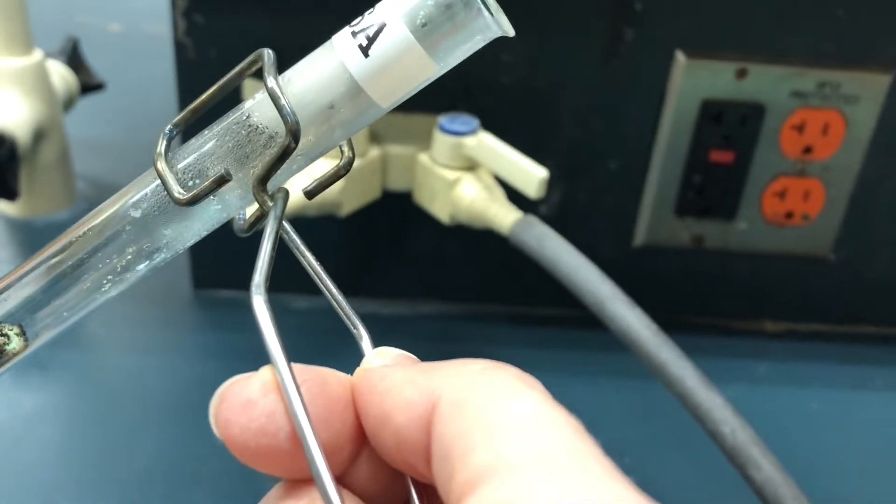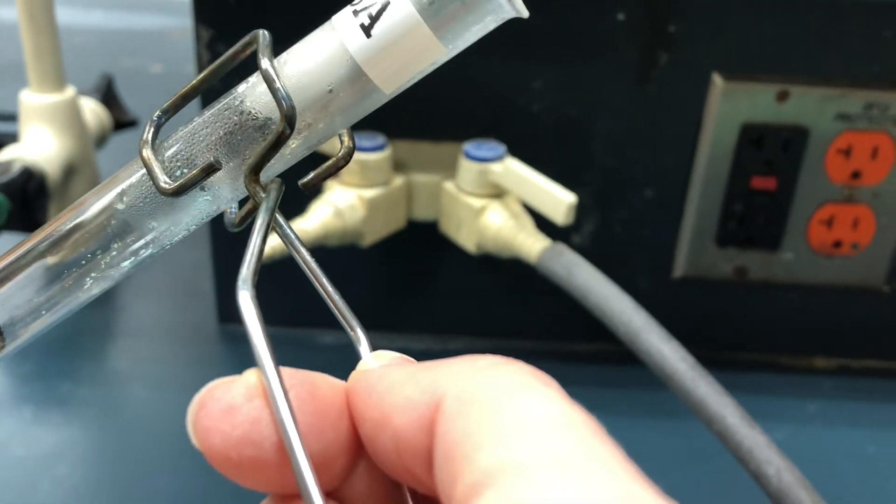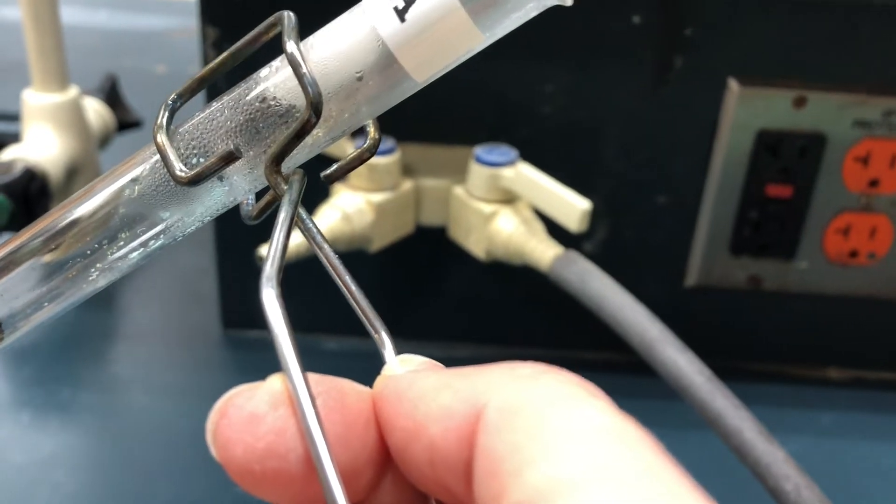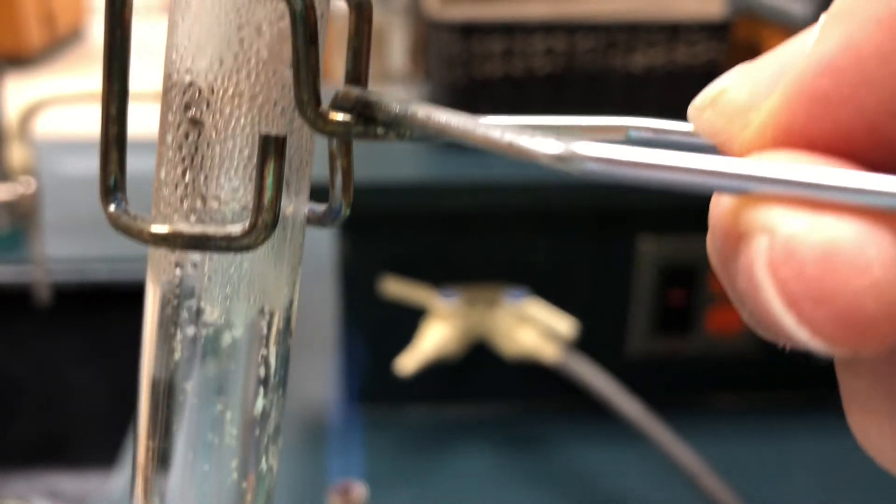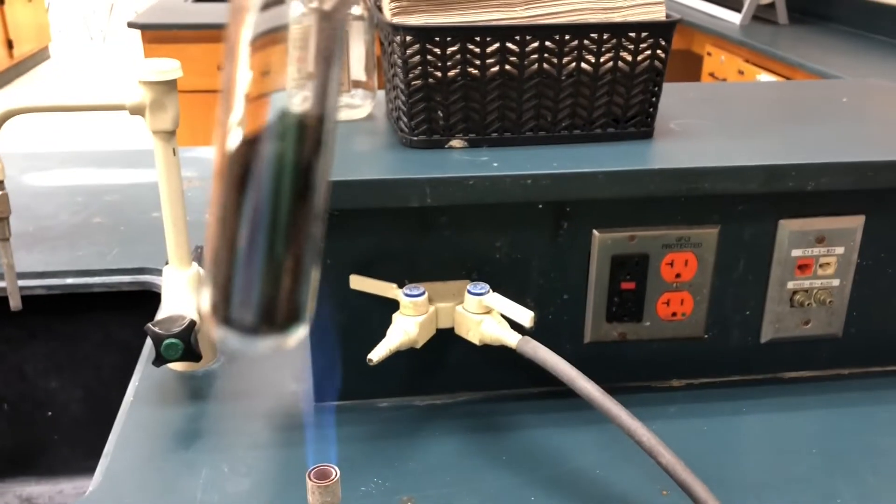I'm going to show you also a little bit further up the test tube if you can make some observations of what happened up there as well. I'll pull it off the flame, start at the top of the test tube and then go down.